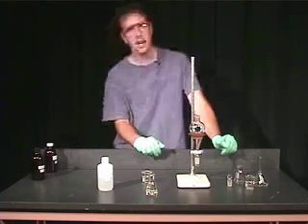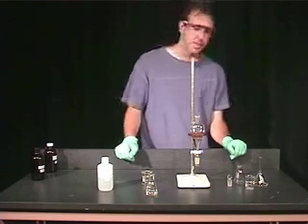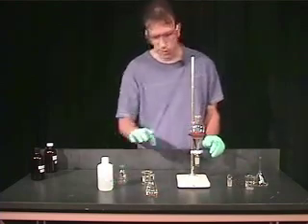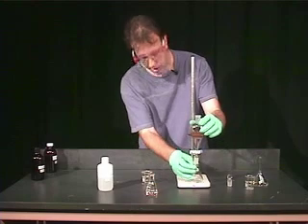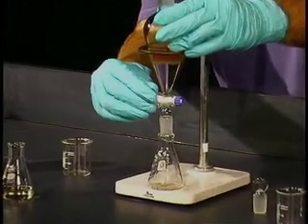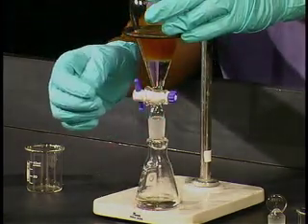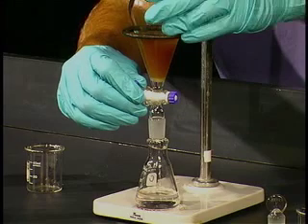In this particular case the emulsion is not bad. You'll follow the general procedures in your notebook or lab experiment. In general, you'll leave the emulsion with one of the two layers. Here we want to keep our organic layer — the bottom layer is our organic layer — so we'll take that out. We're going to keep the emulsion with the dichloromethane layer, the organic layer.